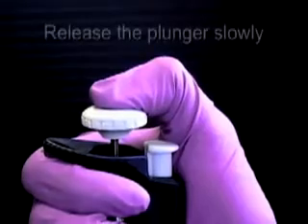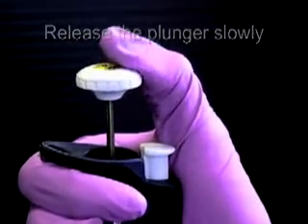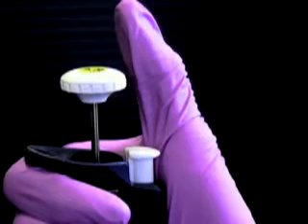If you do find an air bubble in the tip, dispense the sample into a waste container, check your immersion level, and pipette more slowly. If you still see an air bubble, discard your current tip and use a new one. Fourth, release the plunger button slowly. Do not let the plunger snap up. This violent action may force liquid into the plastic shaft.